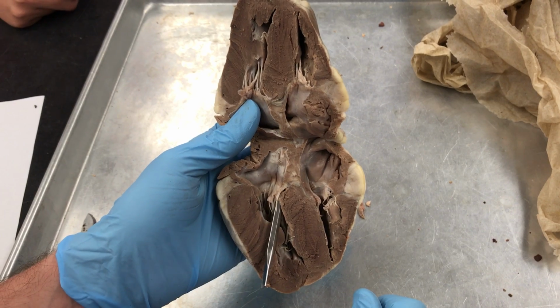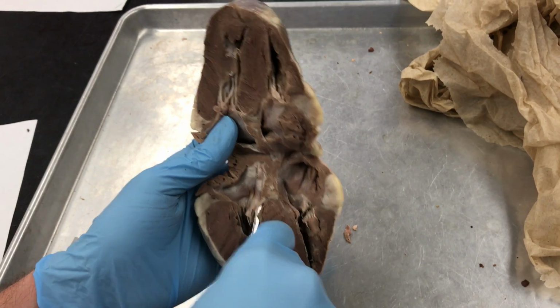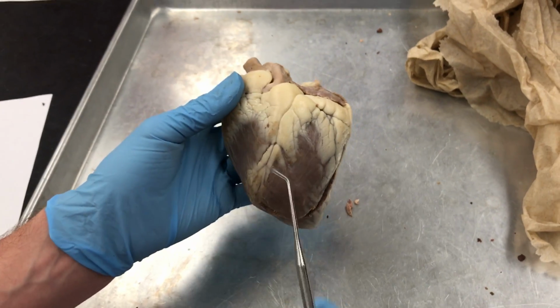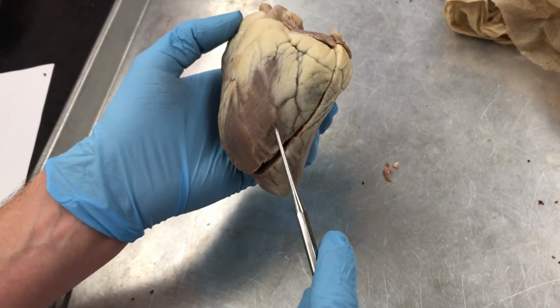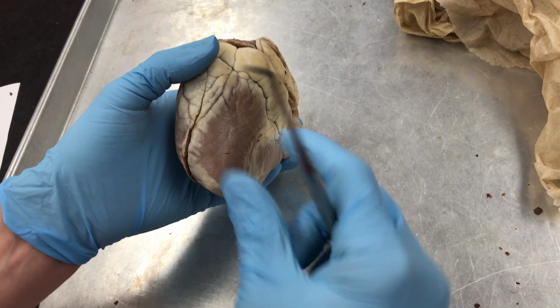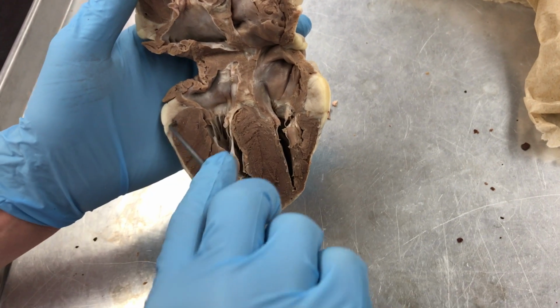Is there anything else we need to do on this? We need the coronary arteries. Coronary. Just know you pointed it out. Yeah, we looked at them. You can kind of see what's happening out here. You can see them better on some of the cats, or I mean the rabbits, because they're injected with red. I'm not gonna pin these, but there are some coronary vessels in here.